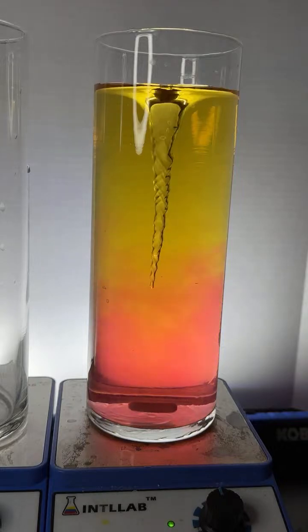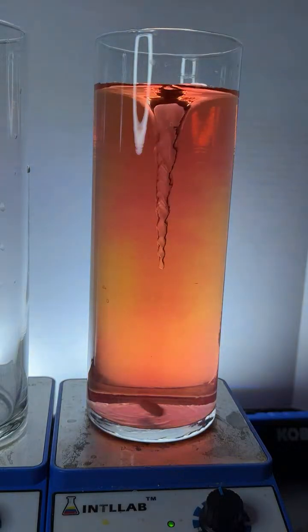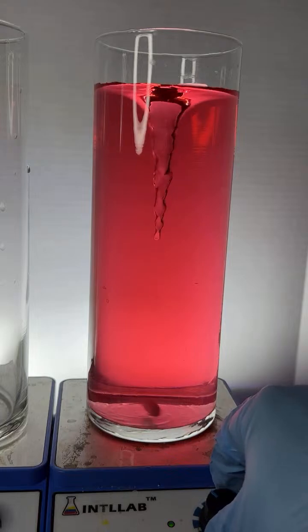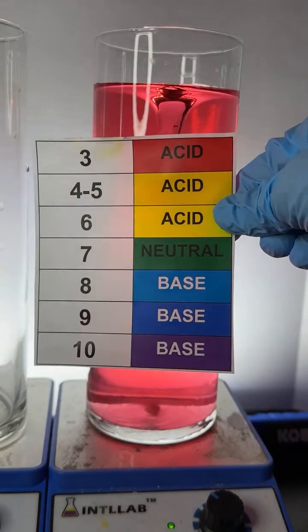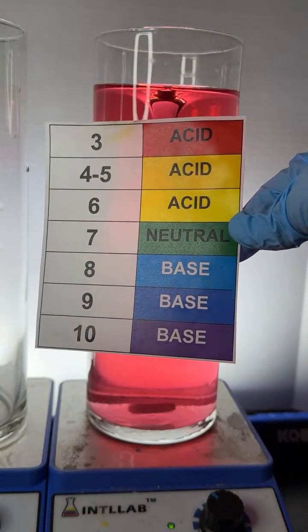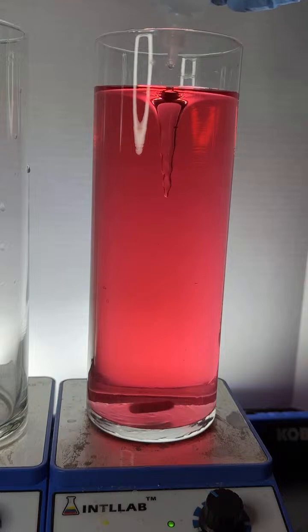Fluid dynamics are definitely cool, Katie. Katie, you're going to love this. I think you already know what's going to happen here, but watch what we'll do. I'm going to go ahead and make it red, which is a very low pH. I'm going to slow the spinner down just a bit, okay? And then I'm going to start adding base to the center of the vortex, which, if you know your fluid dynamics, you should know is pretty low pressure. You should recognize that where I add base, the color will shift to green, blues, and violet. So here we go. I'm going to add base right to the center. 1, 2, 3.